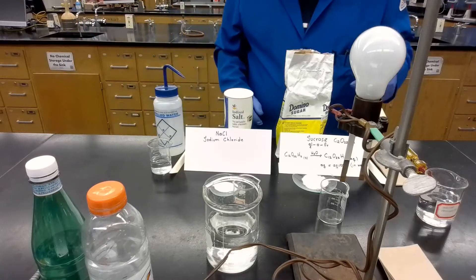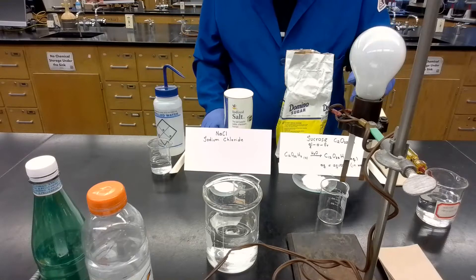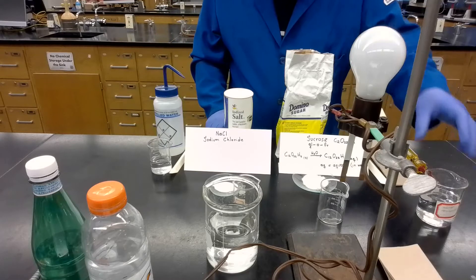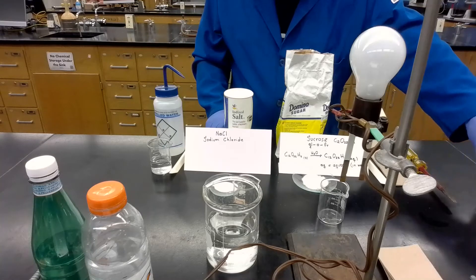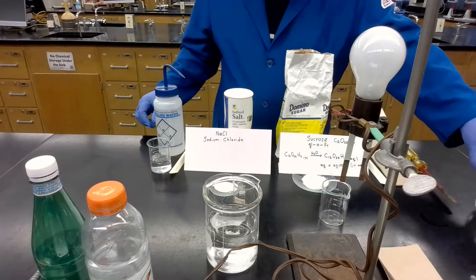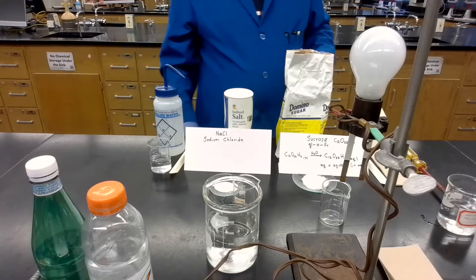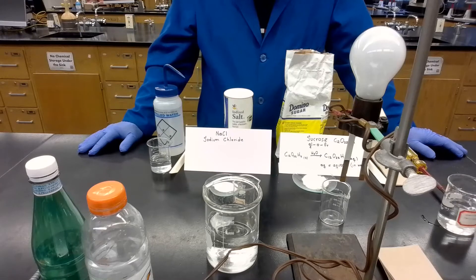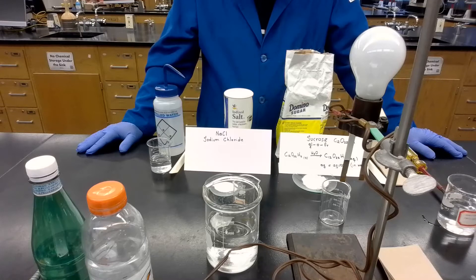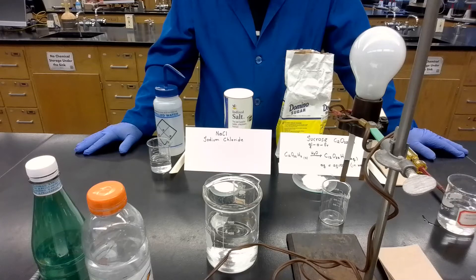Since the purpose of the demonstration is to distinguish between electrolytes and non-electrolytes, we are going to use distilled water and tap water — I got this from the lab faucet. In general, an electrolyte is an aqueous solution that conducts electricity. A non-electrolyte is an aqueous solution that doesn't conduct electricity.